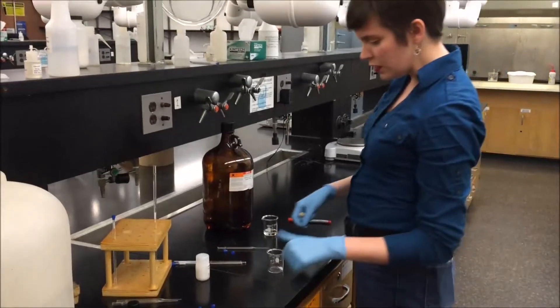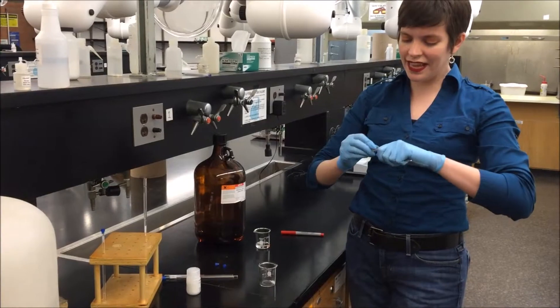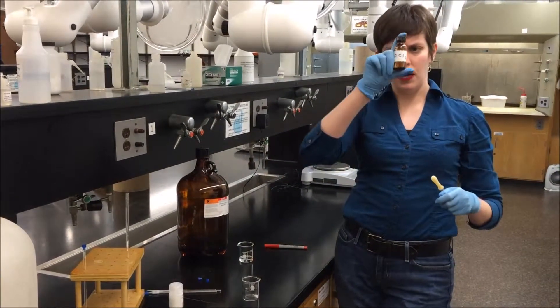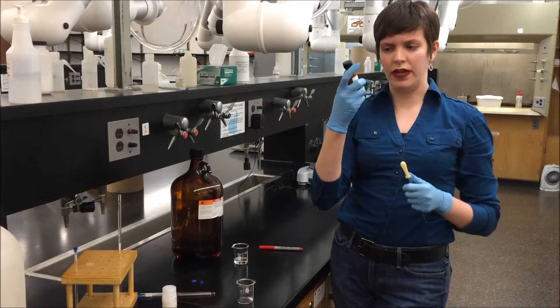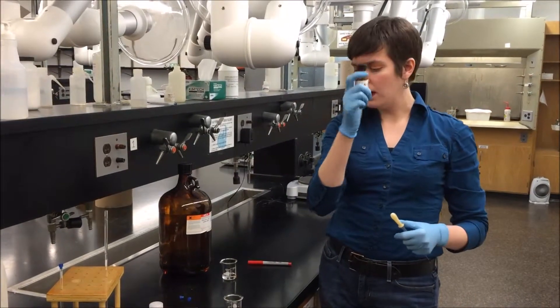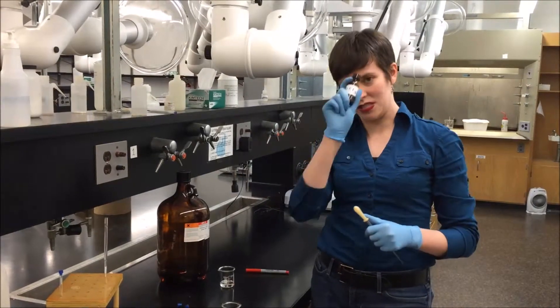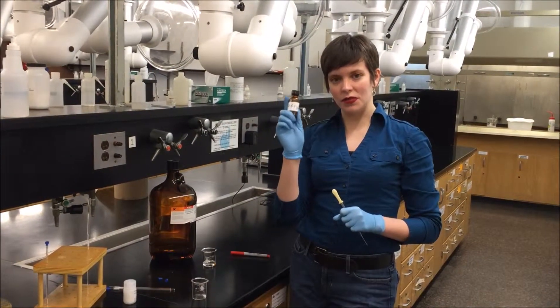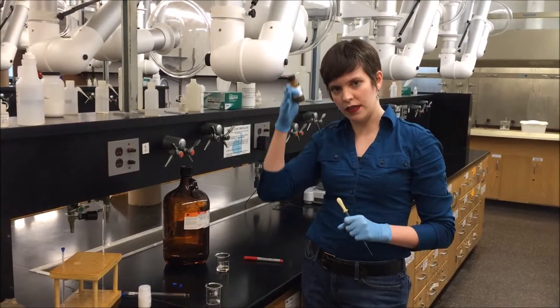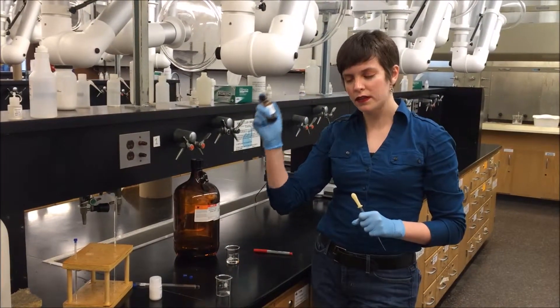I'll get a pipette bulb so that I can bring in the solvent. The solvent we're going to use in the NMR is deuterated chloroform. You can use other solvents too, but they have to be deuterated — it can't have any hydrogens in it because we're going to look at the hydrogens in our sample. This is CDCl3. I'm not going to use this for the demo because it's expensive. The chloroform you're going to use probably already has TMS added to it, which is a reference standard that you set to equal zero in the NMR.